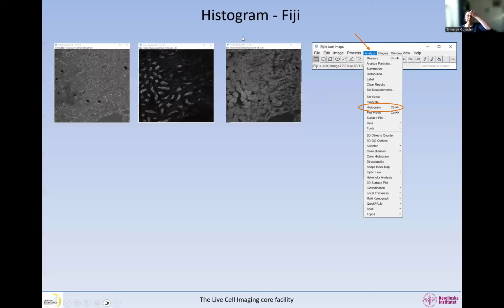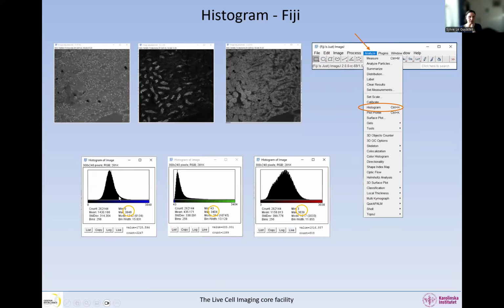So when we look at the histogram in Fiji, we have these 3 images here, and then if we go to Analyze and Histogram, then you will get this histogram, 1 per channel, and you will see in here the minimum and the maximum intensity in the image.